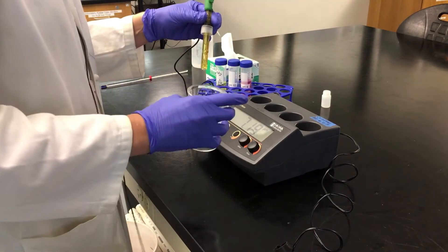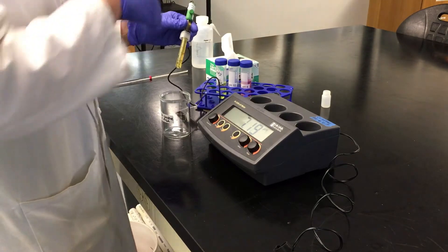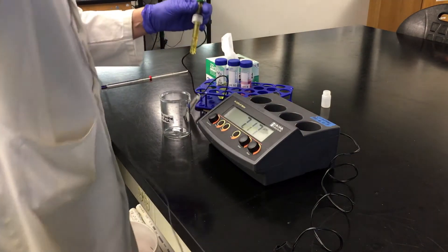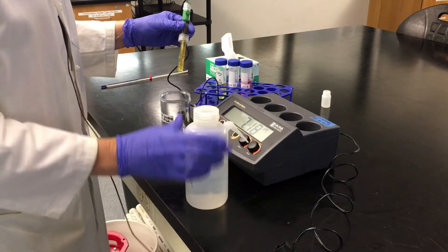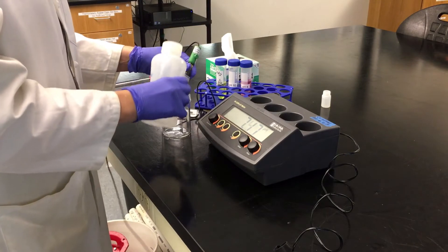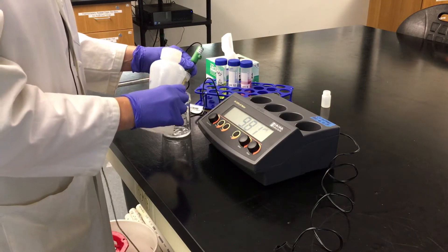You're going to want to have a beaker to collect rinse and a DI water bottle. You want to thoroughly rinse your probe.